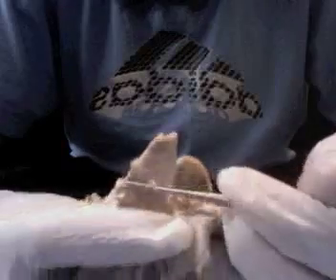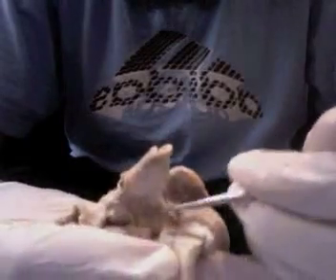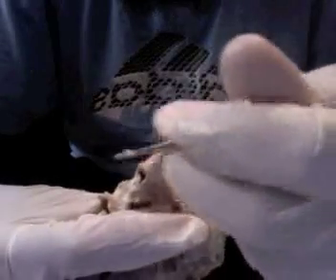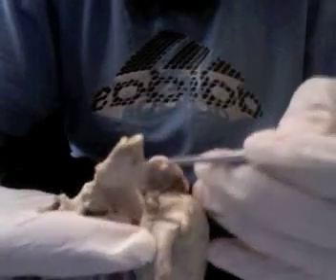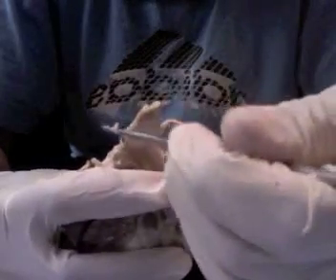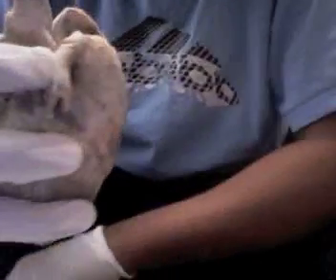Coming off of this, or your ascending aorta, coming off of this would be the arch. The arch is missing, but we do have your brachiocephalic artery. Normally on the arch after that, you would have your left common carotid, and your left subclavian. Those have been cut off.